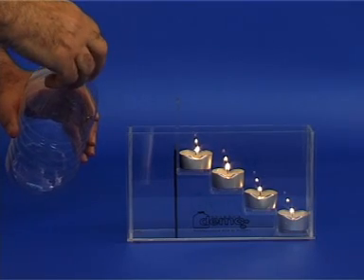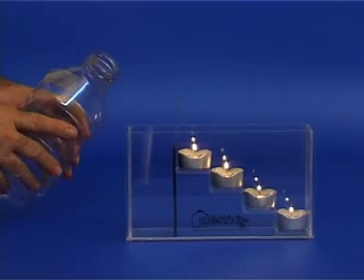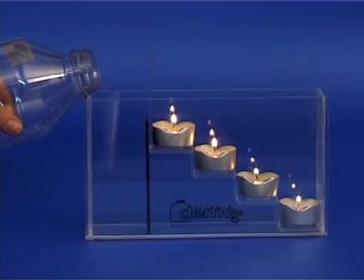Open the bottle and carefully pour its contents into the transparent container. Observe what happens to the flames.